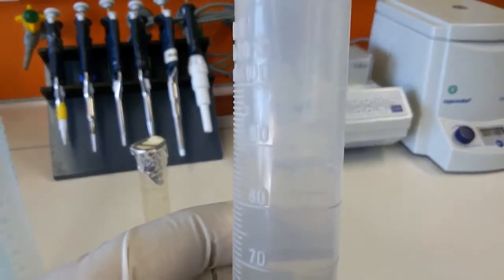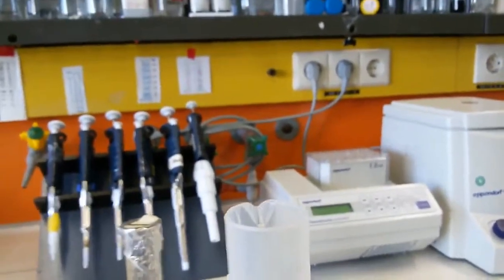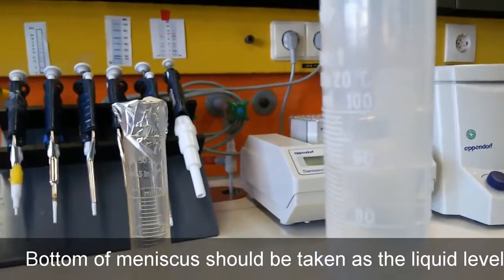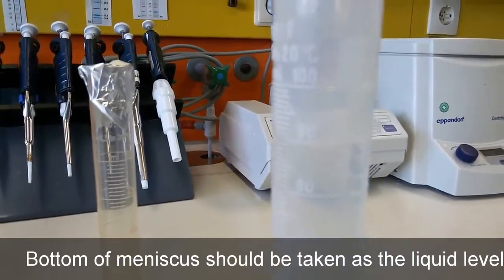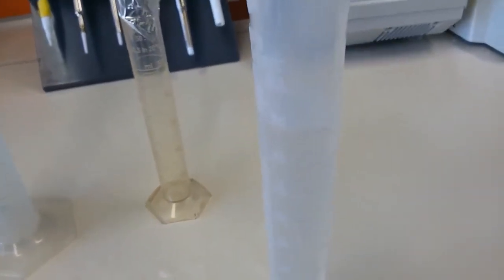This is 80, here is 90, but we only get the right reading when we put it on a plane surface. So now we put it on our bench, and then we can see. This is 90 here, and it is filled till here. If you shake it a little bit, you can see it. That's how you measure, and then you add whatever you want to add. We will tell you about it in our buffer exercise, where we use the measuring cylinder. Okay, cool.